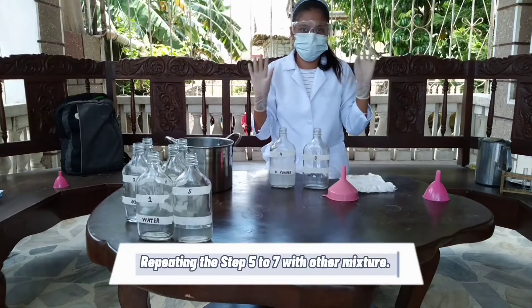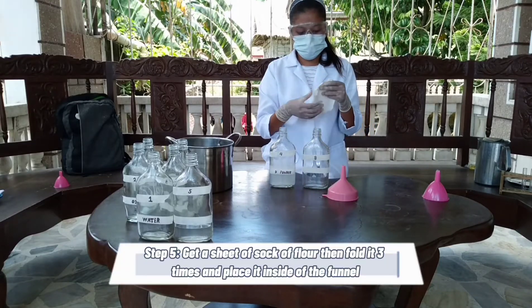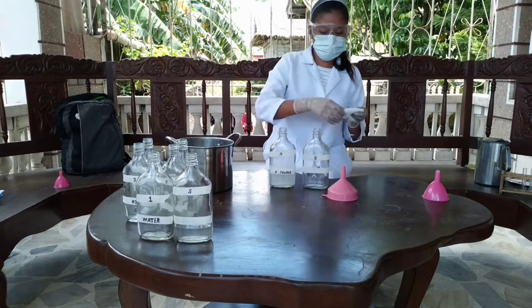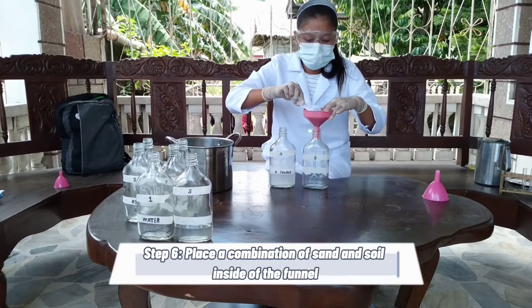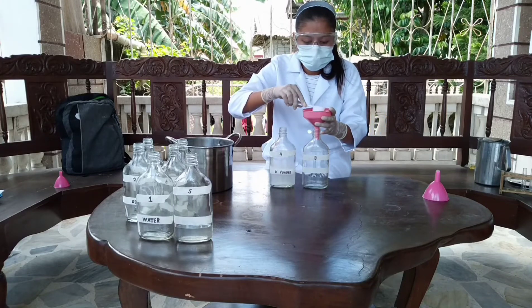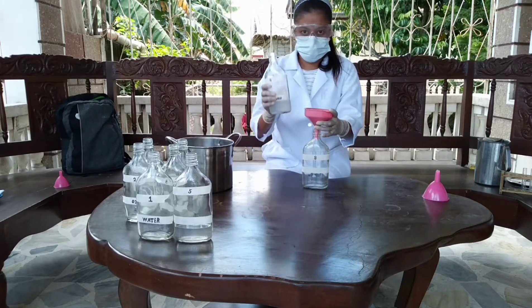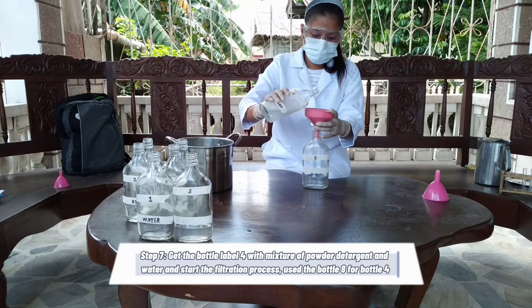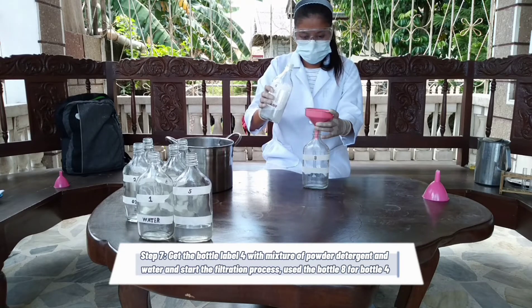Repeating steps five to seven with the next mixture. Step five: get a sheet of sack of flour, fold it three times, and place it inside the funnel. Step six: place a combination of sand and soil inside the funnel. Step seven: get bottle labeled four with the mixture of powder detergent and water and start the filtration process. Use bottle eight for bottle four.